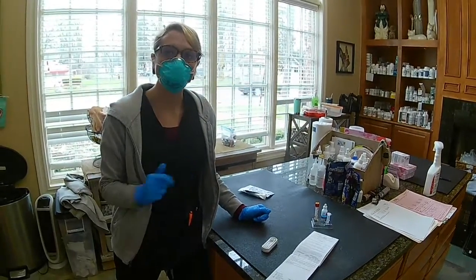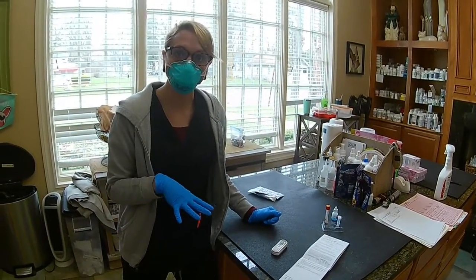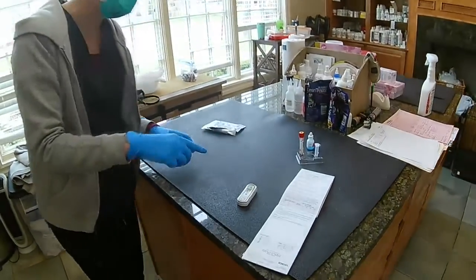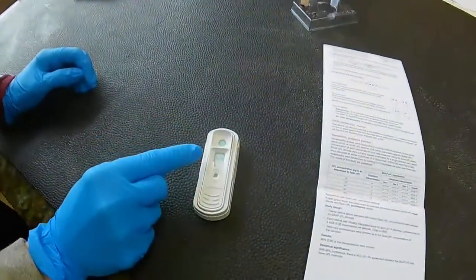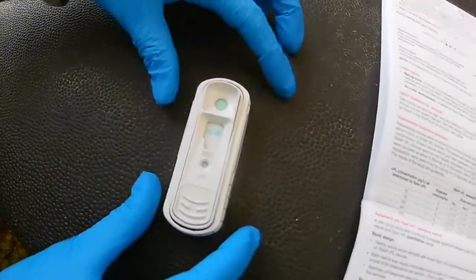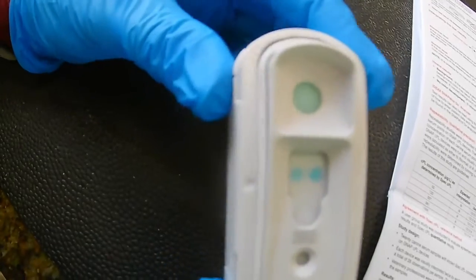All right, awesome. So we're back after our 10-minute wait for the test to run. So if you want to come and zoom here on our results. This side over here is our reference spot, and this is our sample spot on this side. I'll see if I can bring it even a little closer here.